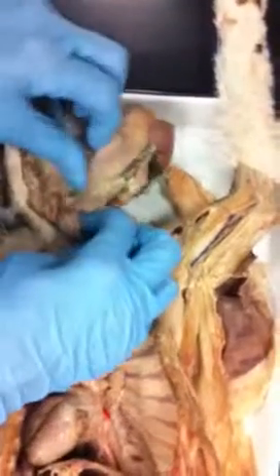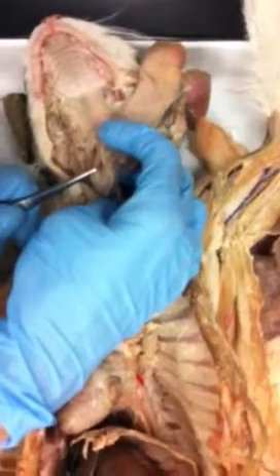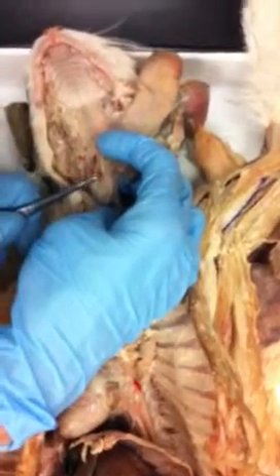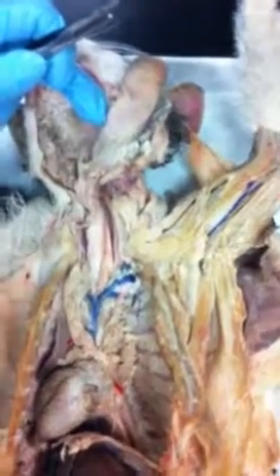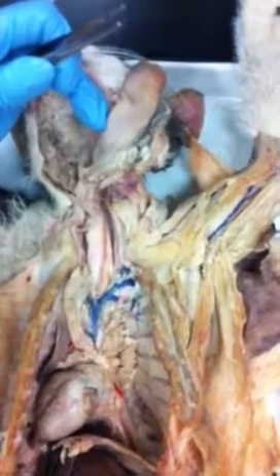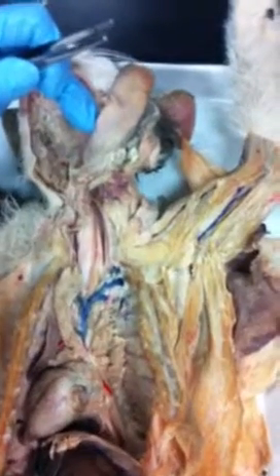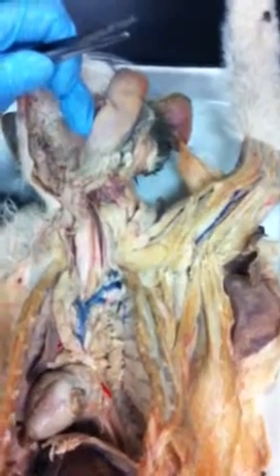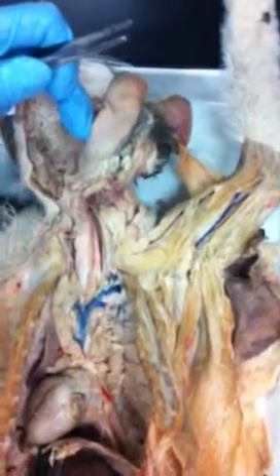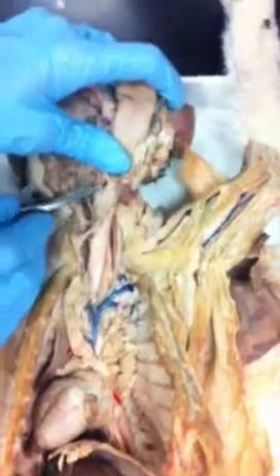You can also see in here, if you look closely, these right here. These are the arytenoid cartilages. Can you turn that around? Yep. Those are the arytenoid cartilages right there, and those are attached to the vocal folds in there. So if you squeeze those, then you move the vocal cords like that. So again, these are the arytenoid cartilages right here. These hard things right there in the cat.